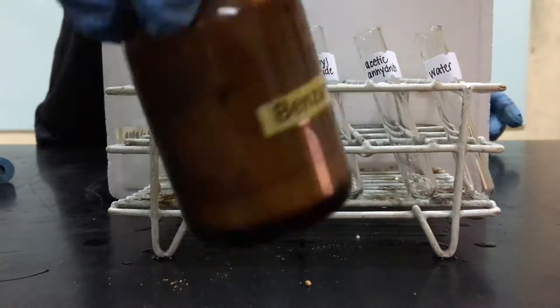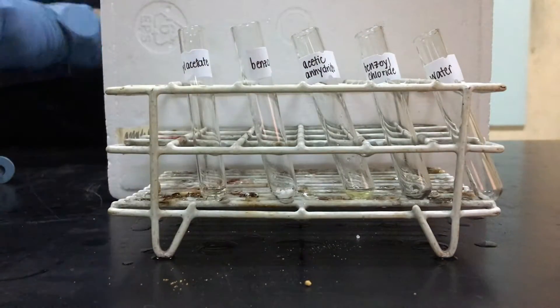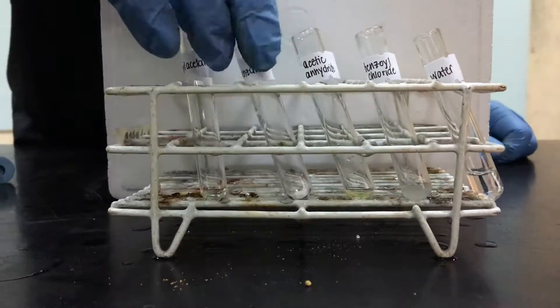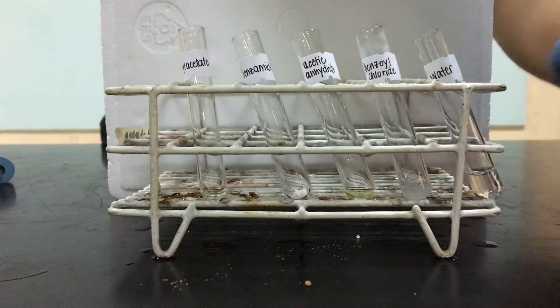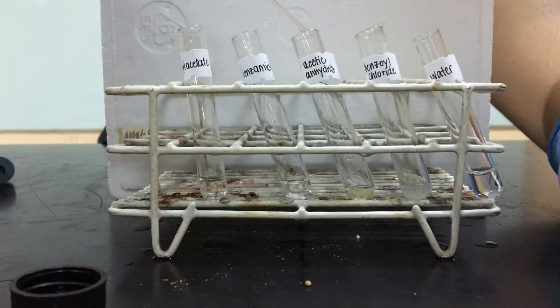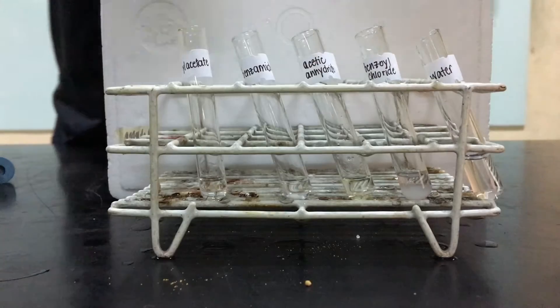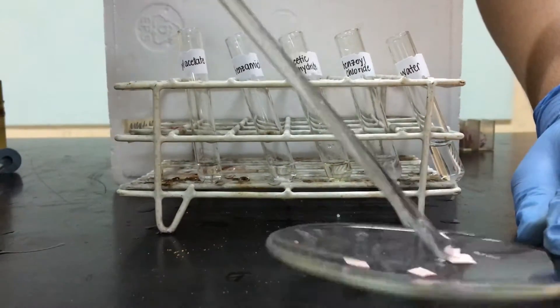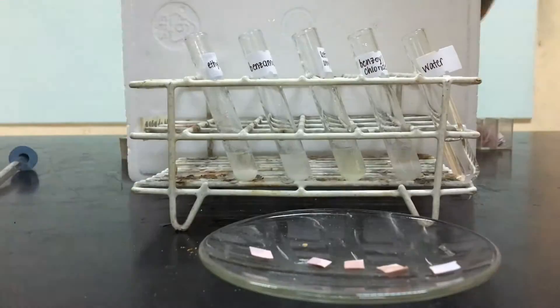First, we add 5 drops of our samples to each test tube. Next, we add 20 drops of 7% hydroxylamine hydrochloride. We make the solution basic by adding 10% methanolic potassium hydroxide until the mixture turns red litmus paper blue, then we add 10 drops excess.